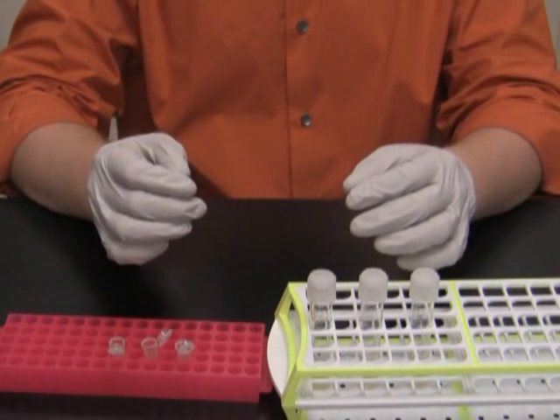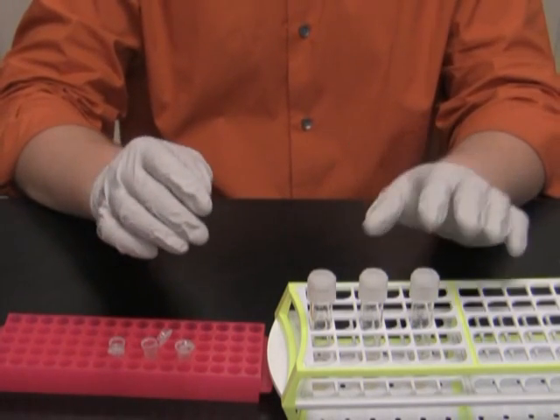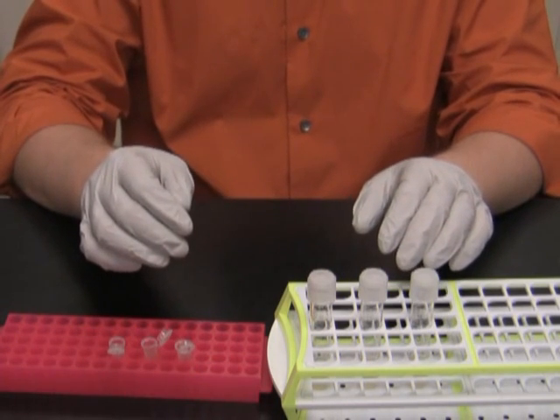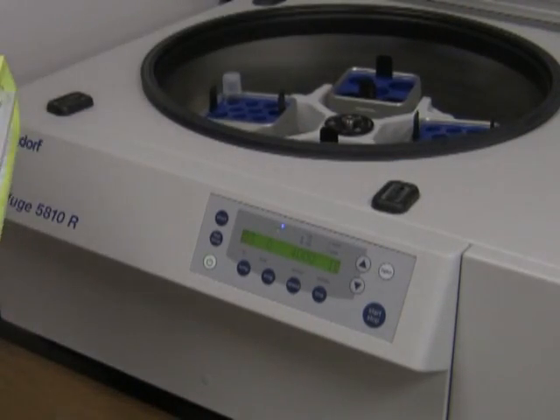Now I'm going to proceed with the plasmid mini prep kit to isolate DNA from these cultures. If you've used plasmid mini prep kits before, fast forward to the next step. First I pellet the cells by spinning the culture tubes in a centrifuge.